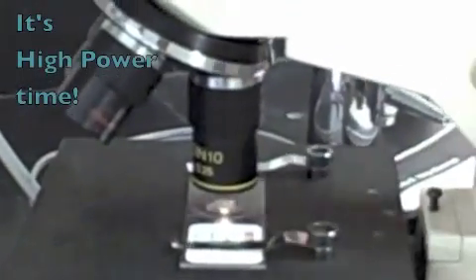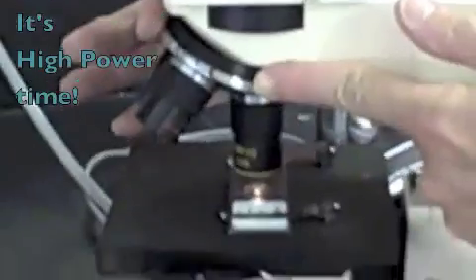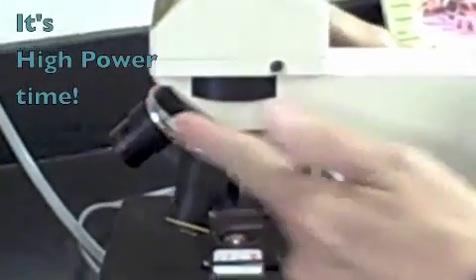Now, I'm ready to put it on to high power. So, I'm going to use the revolving nose piece to move the objective lens into 40x, the blue lens, until it clicks into place.